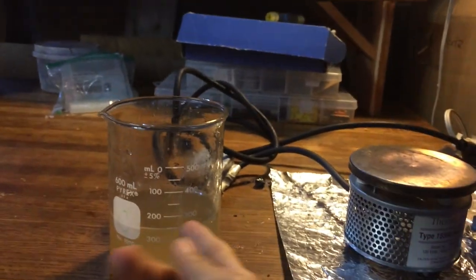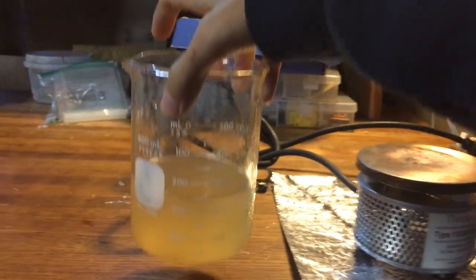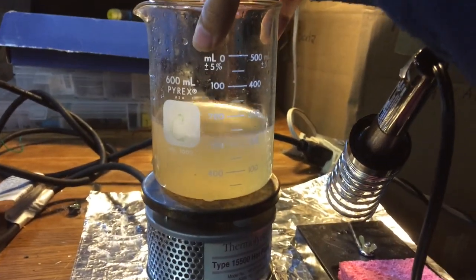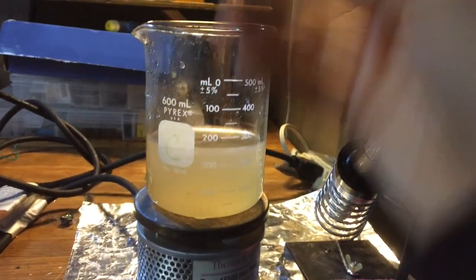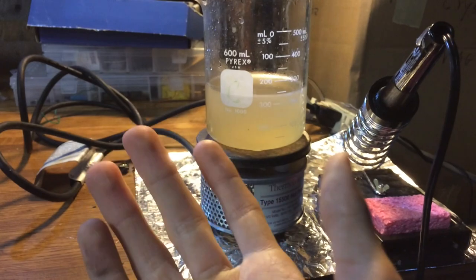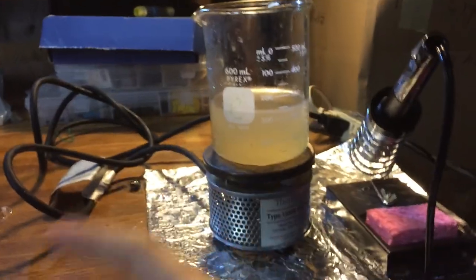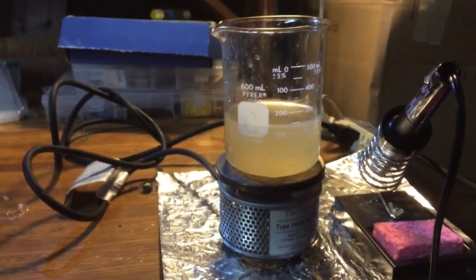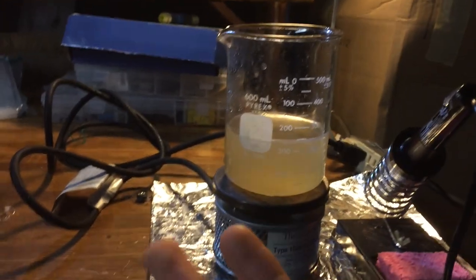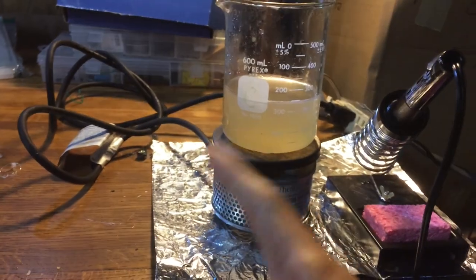I'm going to take the solution of tap water and calcium chloride, and hopefully not many contaminants, and put it on this hot plate. I should be wearing nitrile gloves. I haven't been wearing them for most of this experiment because I'm too lazy to get some. I'm not saying you shouldn't wear nitrile gloves, though — wear your gloves, kids.